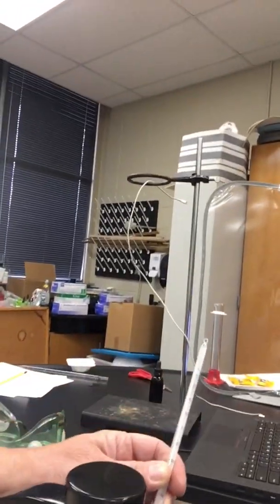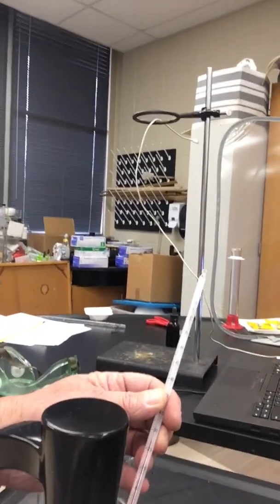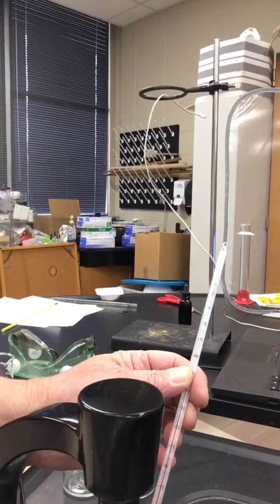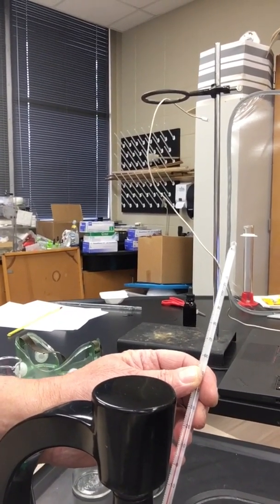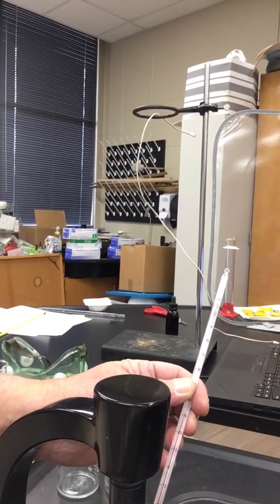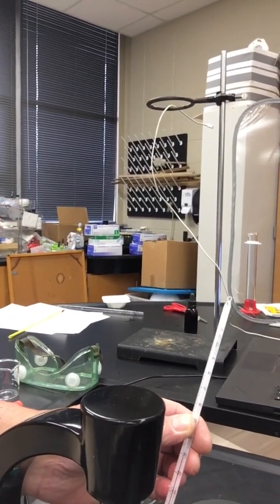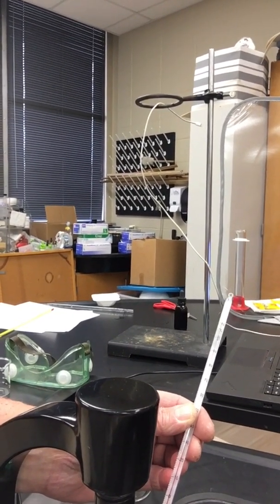And the warm water, it kind of depends on what you have your thermostat of your water heater set on at your house. Usually you don't want it to be too hot, because then you might make it too hot in the bathtub. But you want to make it hot enough that you can wash your dishes and your laundry. Okay, and it looks like even that's kind of cool today. But we'll go ahead and just take that temperature so I don't waste too much more water. And that would be 29 degrees Celsius.